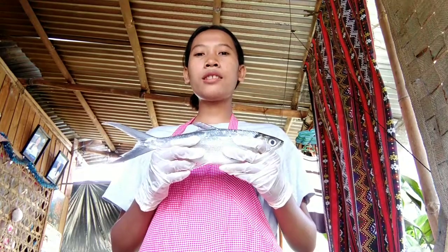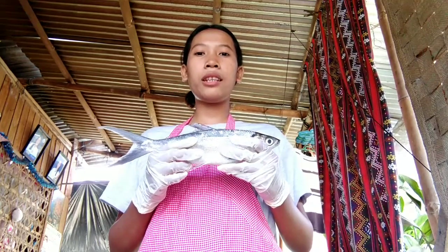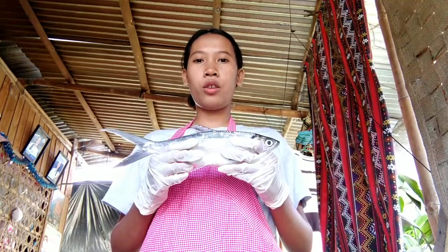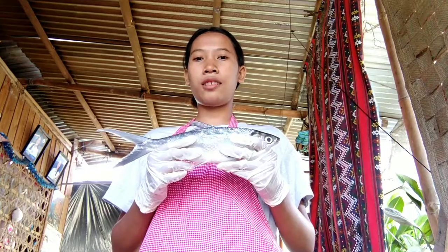Fins are used by the fish to maintain its position, move, steer, and stop.